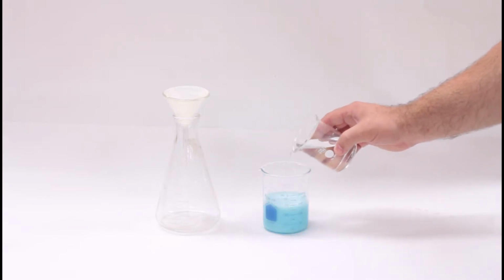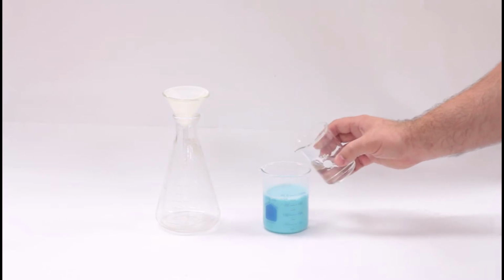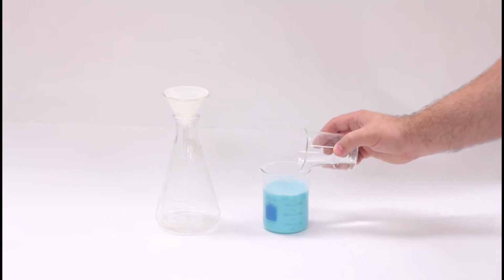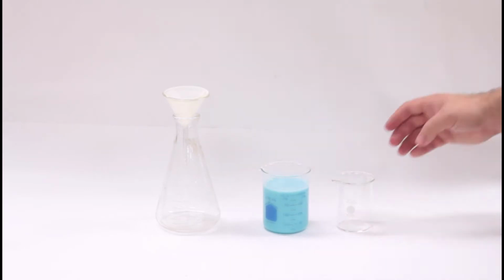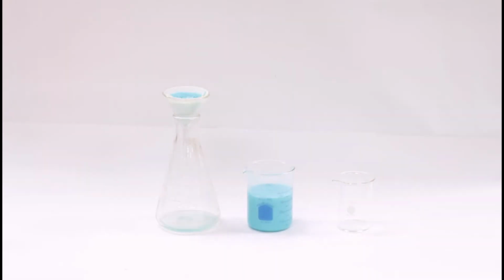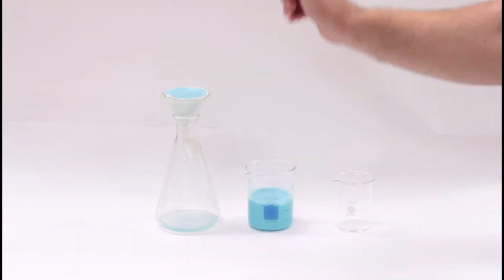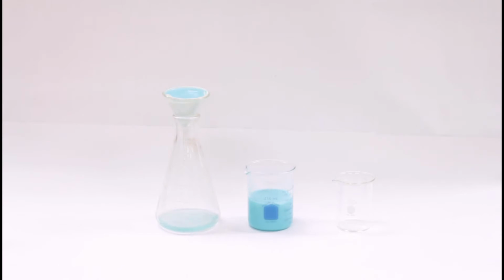There are many separation techniques in chemistry because when we make a specific chemical, there are often undesired side products, or we might need a dry product that we made in a solution. Regardless of the reason, there are methods to separate gases, mixtures of two or more liquids like distilling gasoline into mineral spirits, and separating mixtures of liquids and solids.